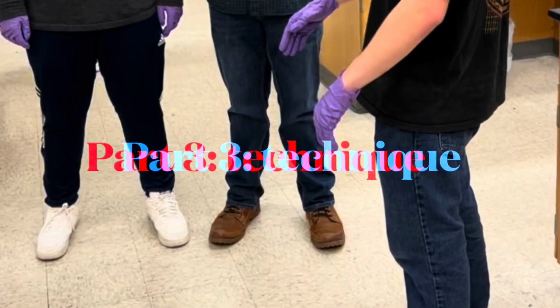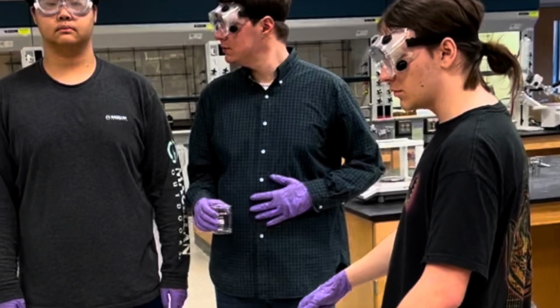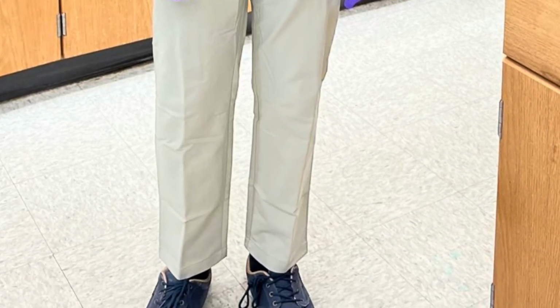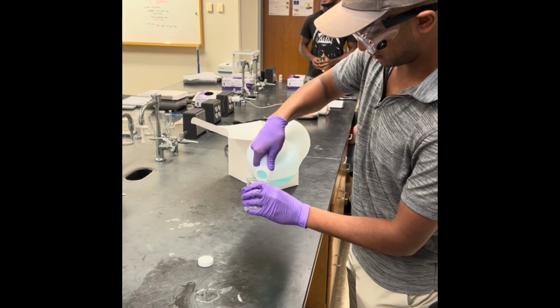All members of the lab group are seen wearing proper clothing for the lab, which are closed-toe shoes, long pants, goggles, tied-up hair, and gloves. After checking for proper attire, members can be seen transferring the stock solution into a beaker for the next step of preparing the solution.